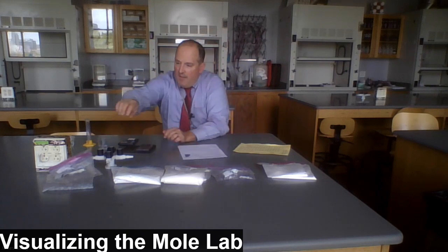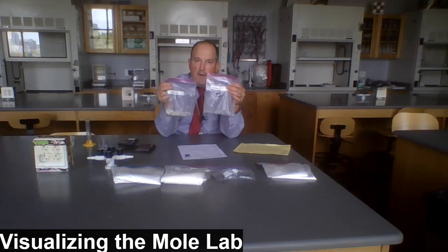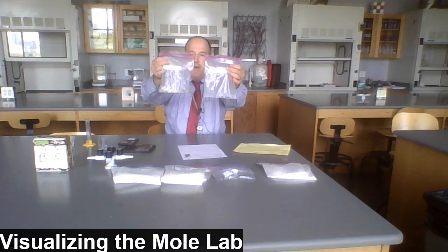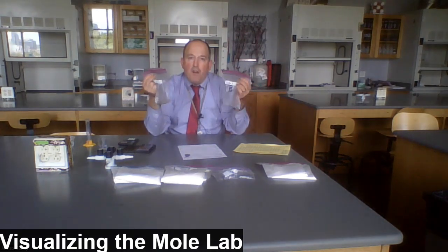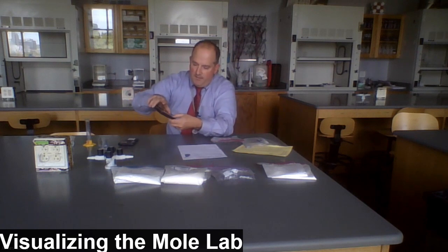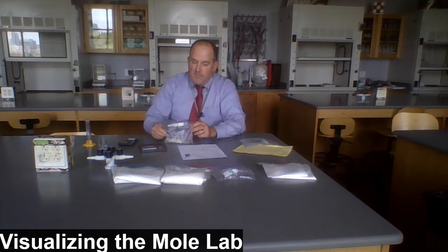Station 2. In station 2, we're going to use 2 samples of metals. They're both samples that are 1 mole each. One of them is zinc and one of them is tin, and they're both somewhat shiny, grayish colored metals. But at first, I wouldn't know which one is which. What I'm going to use to figure out which one is which is the mass. So I'm going to use my electronic scale. I'll turn it on.